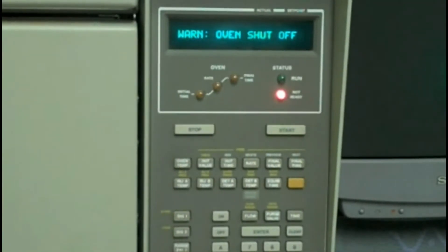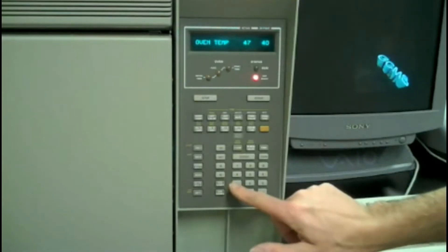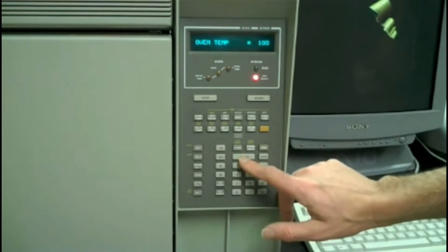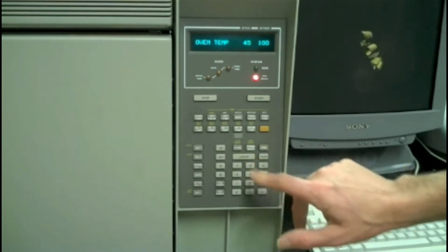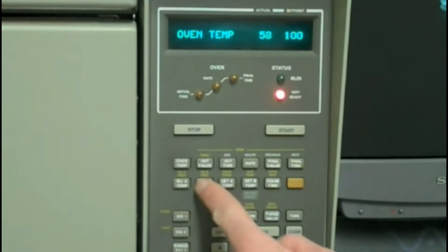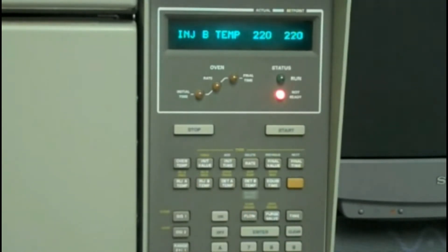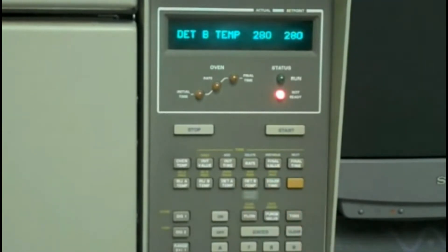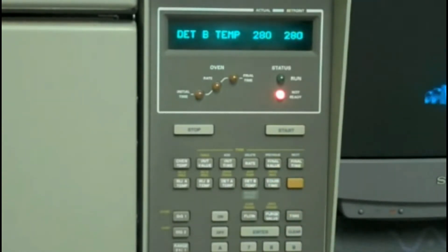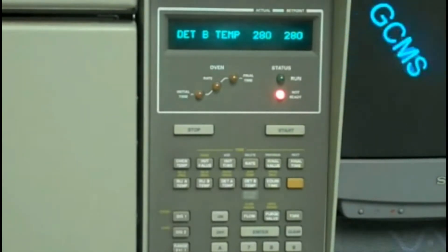The oven temperature can be set manually from the controls on the front of the panel — type in the new value and press the enter key. You can also set the temperature of the injection port, which is in position B on this instrument. The upper limit is 280 degrees centigrade. The separation column passes through a short transfer line between the oven and the mass spectrometer, which should also be heated to 280 degrees.